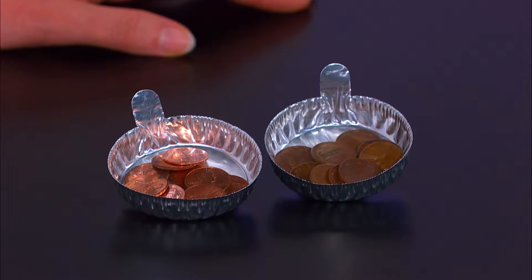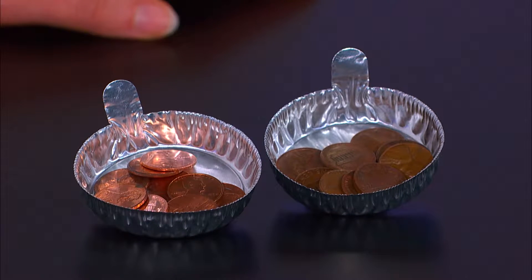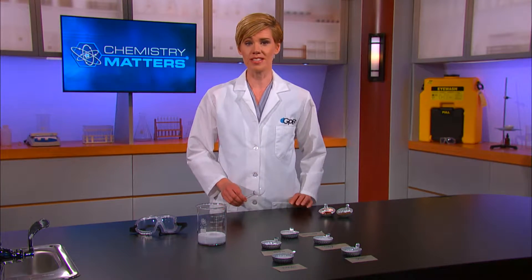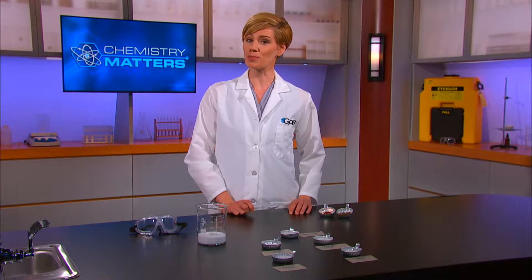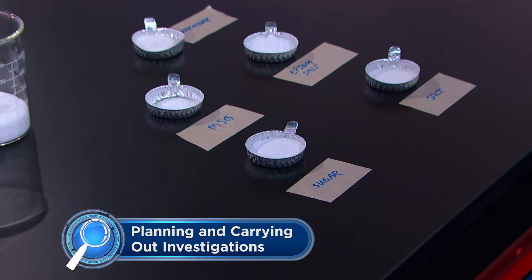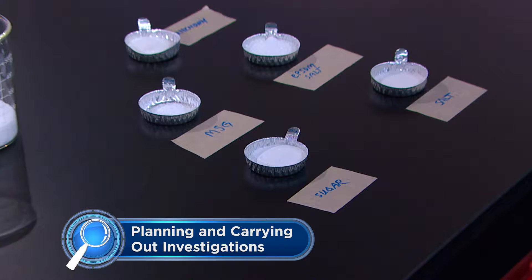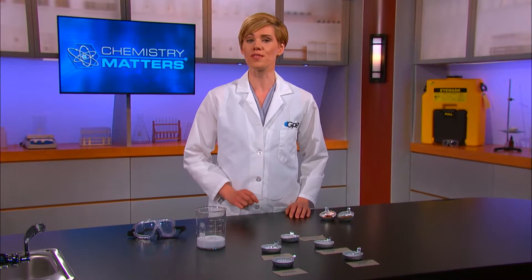But density is only one physical property used to identify matter. To help identify chemicals, we need to look at additional physical properties. Another easy and fun test you can use is something I like to call crushability. So let's do a quick activity where you'll explore the crushability of five different crystals. You're going to design a crushing test that identifies an unknown chemical. Your teacher will give you five chemicals to crush, one of which won't be identified — we'll call that one the unknown.